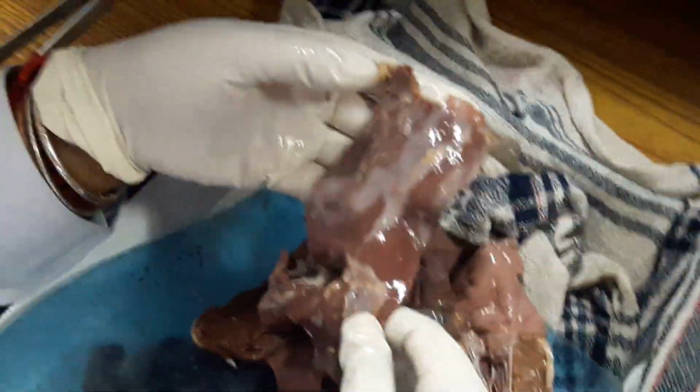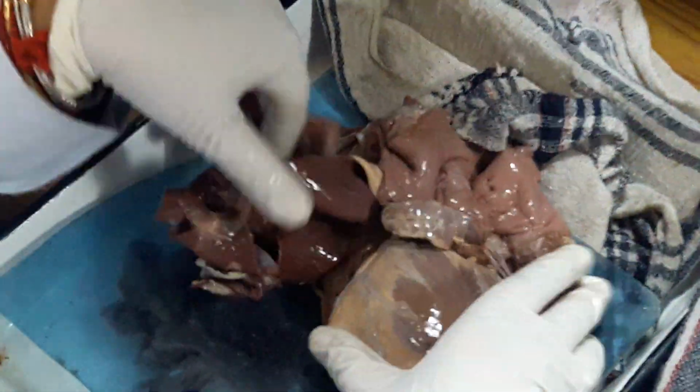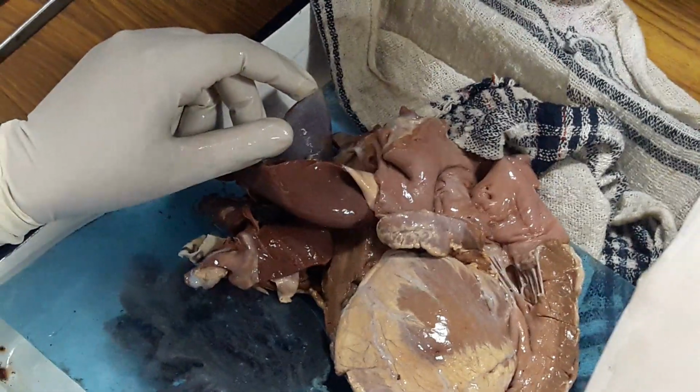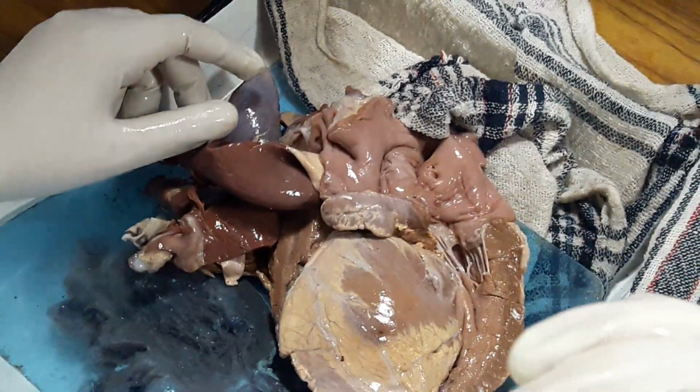It is not causing any occlusion at all. In the aorta, occlusion usually does not happen, but you can see ulcerated thrombus formation with ulceration of the endothelium, okay, or denudation of the endothelium.